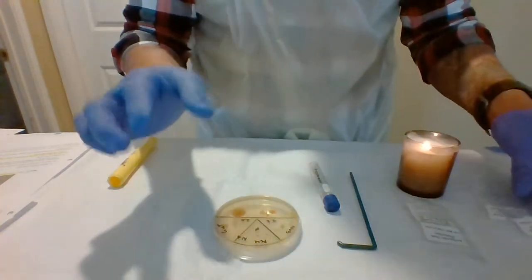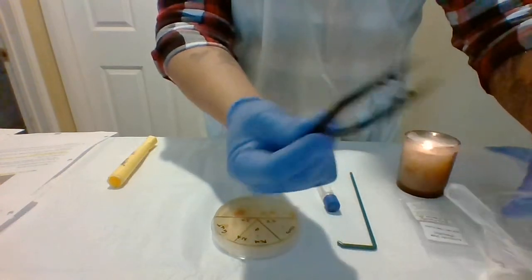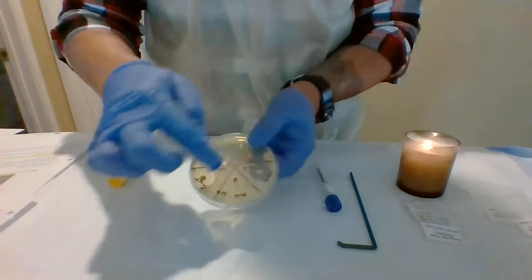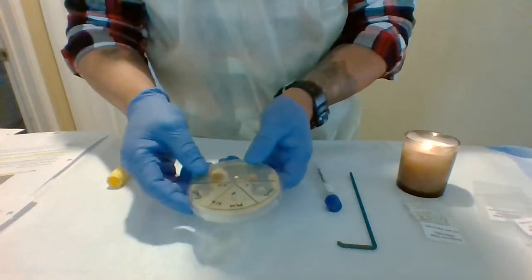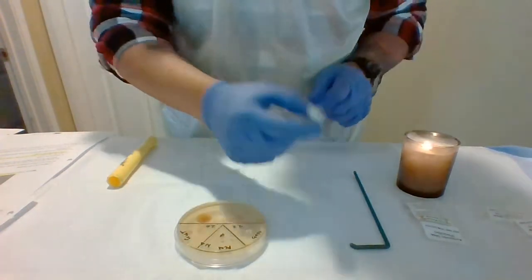But I've already done the lab, so I'll be going over the purposes, okay? My pipette with alcohol and my tweezers. So first I want to do is make sure I mark all the necessary areas in the 3 quadrants. I'll use a permanent marker to do that. So I'll remove the lid from the test vial.